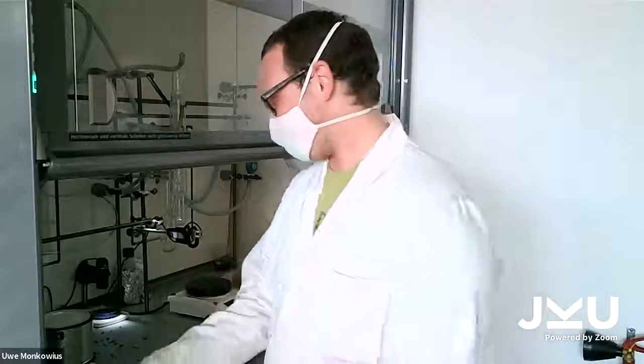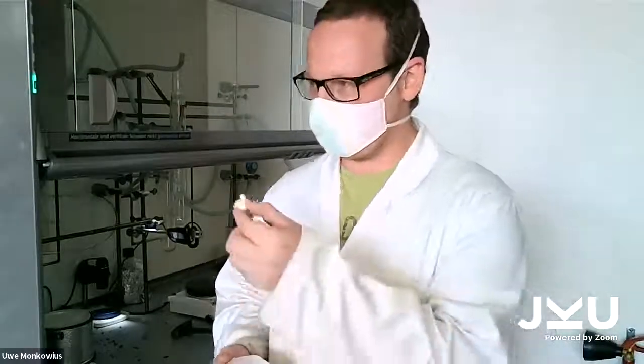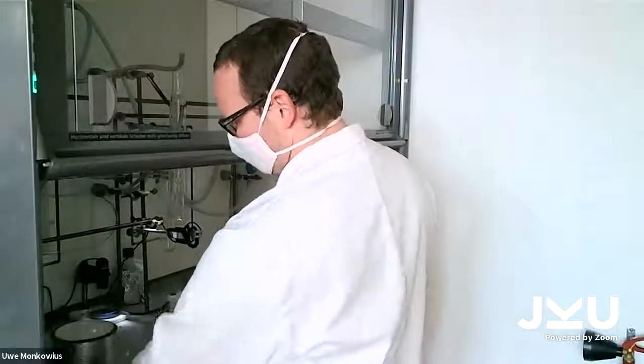But now we will show you a really dangerous experiment. Something that's prohibited in the lab. You should not do that in the lab. For that, I'm going to take some popcorn and put it into the liquid nitrogen.